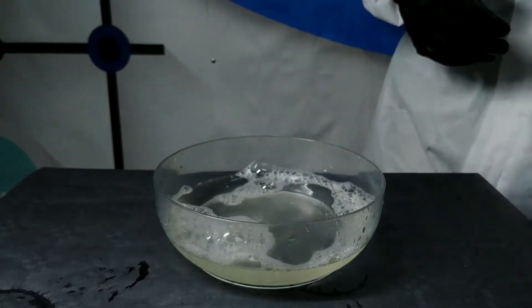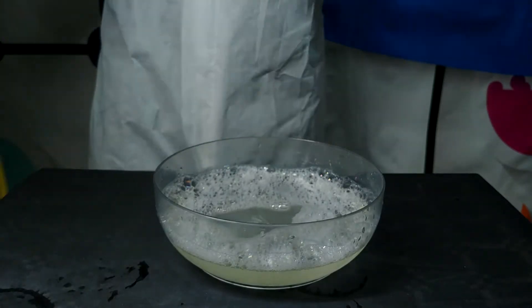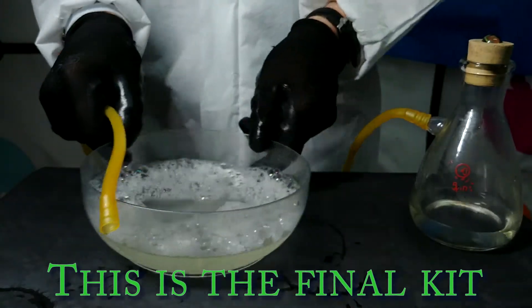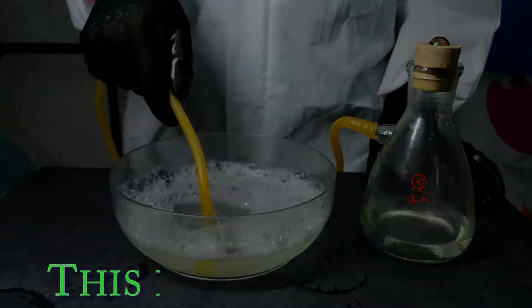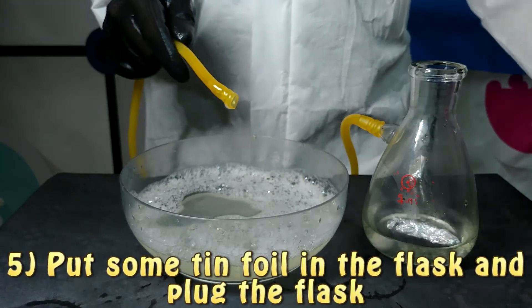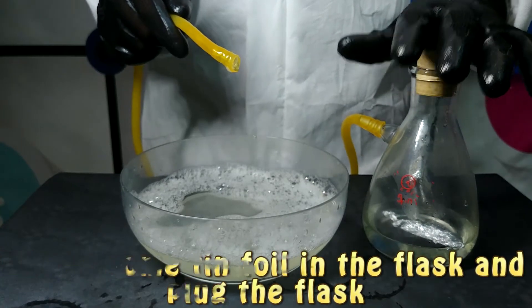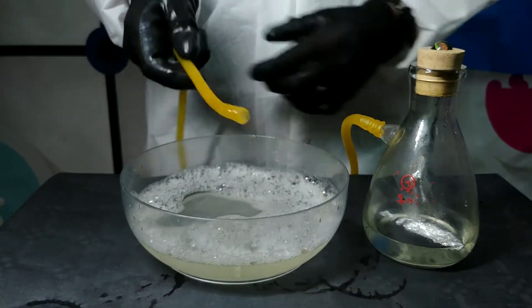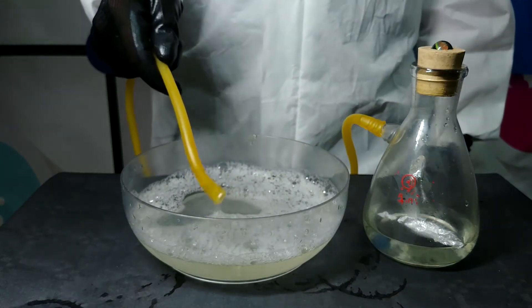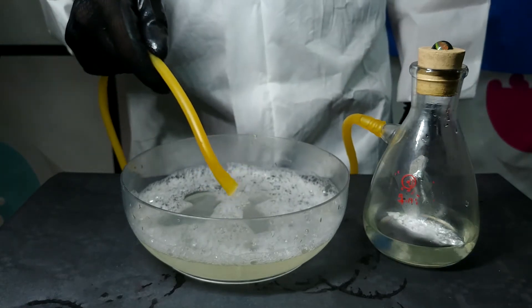After that we are going to take our conical flask and put some aluminum in it. Remember that the gas will start forming, so you should put the plug on the conical flask in order to stop the gas from exiting from the upward-facing aperture so that it goes through the sideways-facing one. Then we are going to put the flexible tube inside the recipient and we will see bubbles forming. Then we are going to ignite them with a lighter or some matches and see what happens.